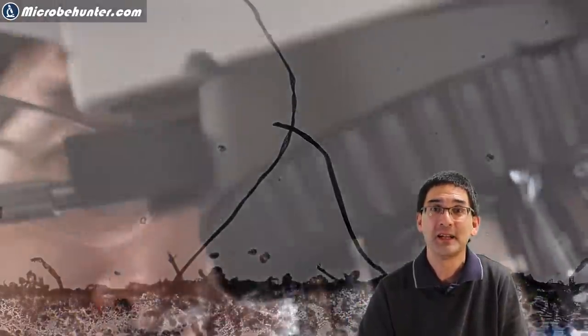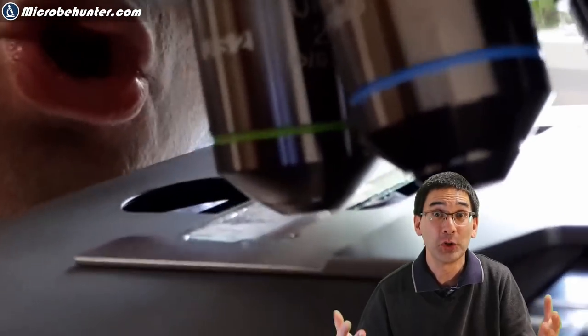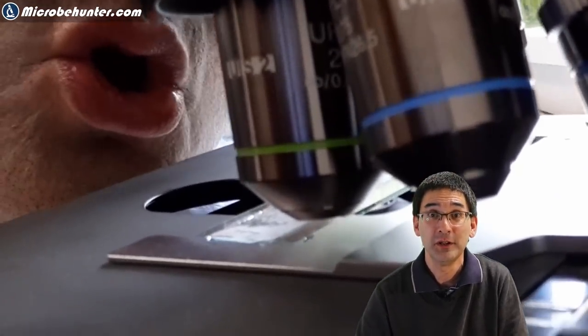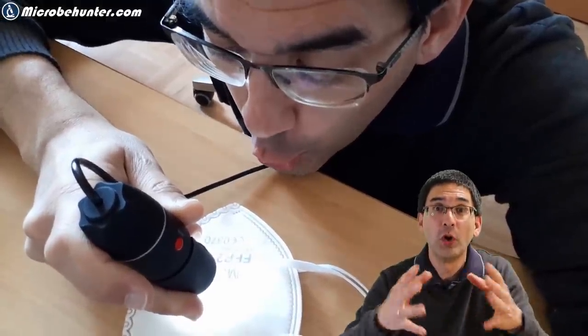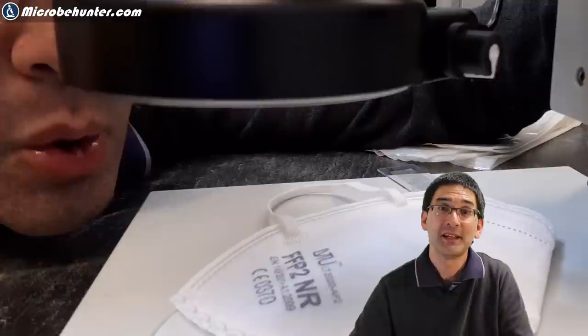They would simply not be able to survive. And this is basically what I have done. I simply carefully exhaled and have blown on my face mask and then the fiber started to absorb the moisture.